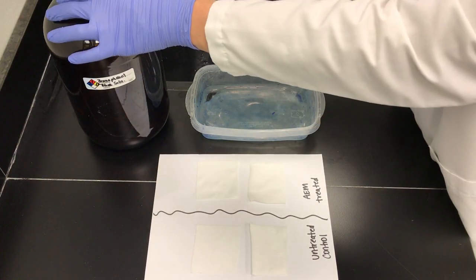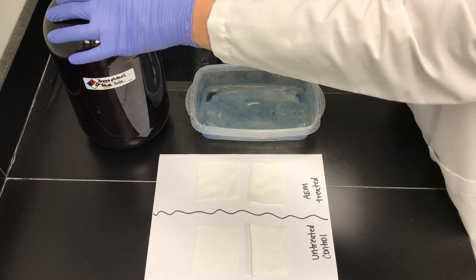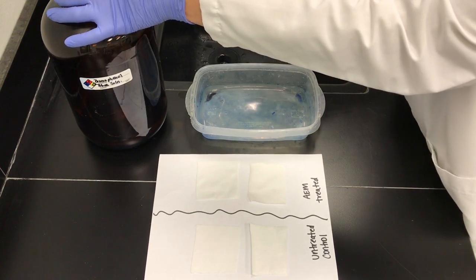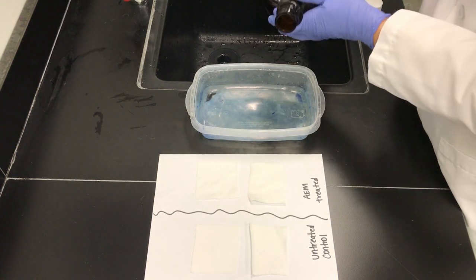Start by preparing a 0.25% solution of bromophenol blue sodium salts. One could add a surfactant to the BPB solution if needed for samples that are hydrophobic.